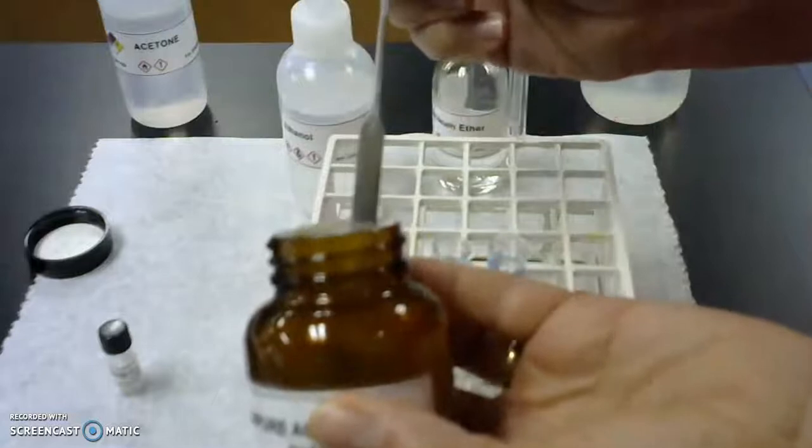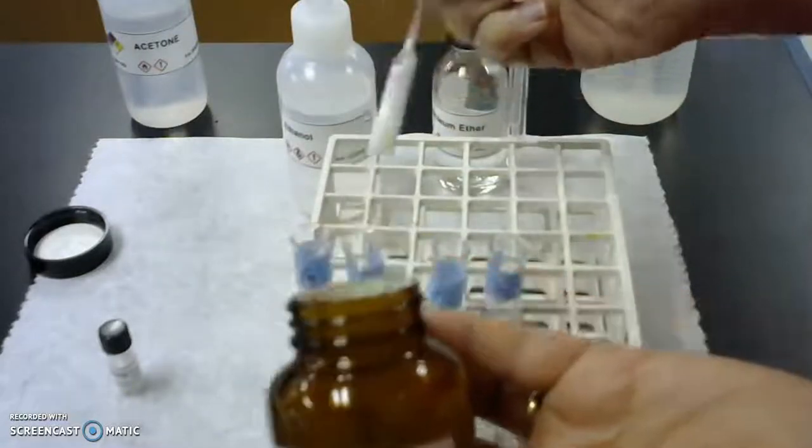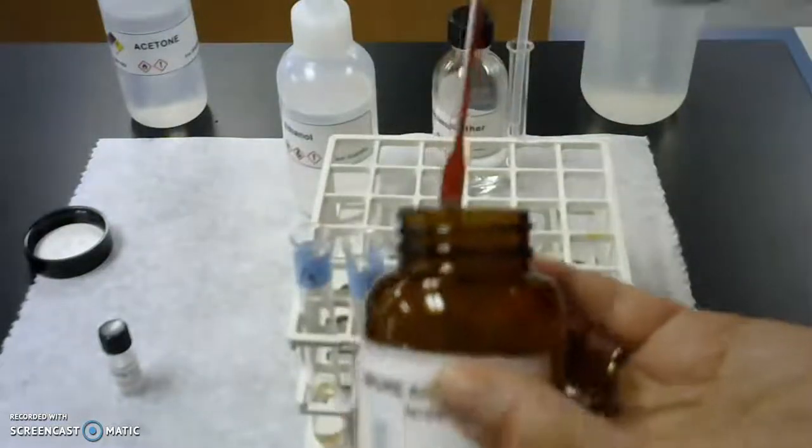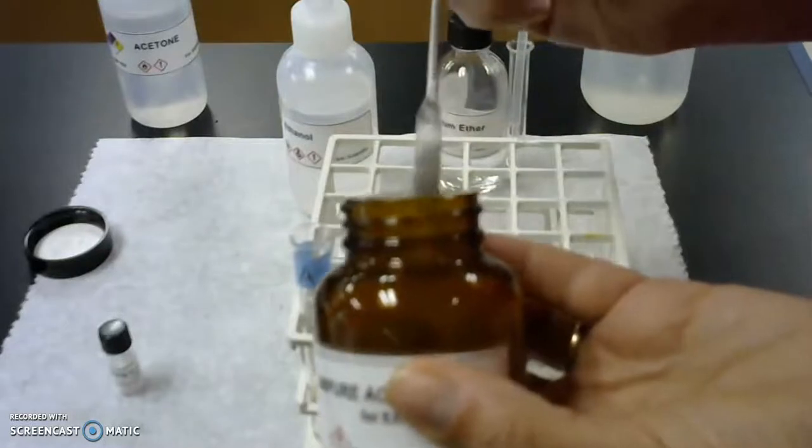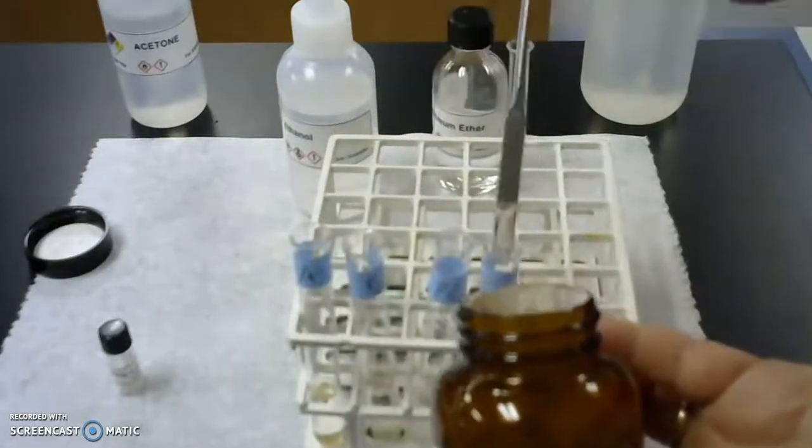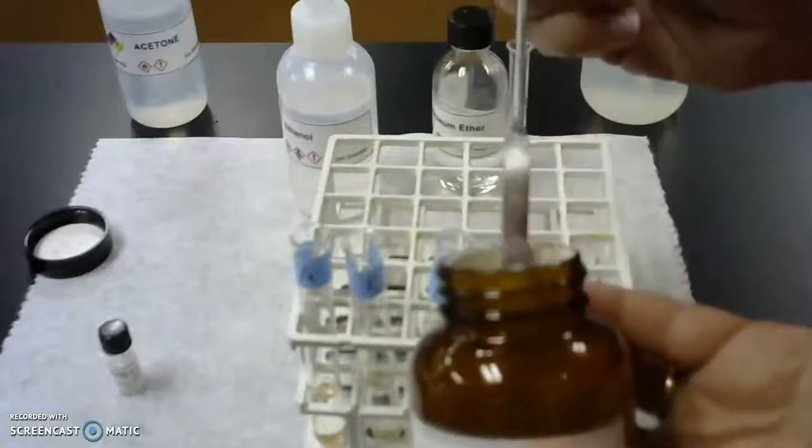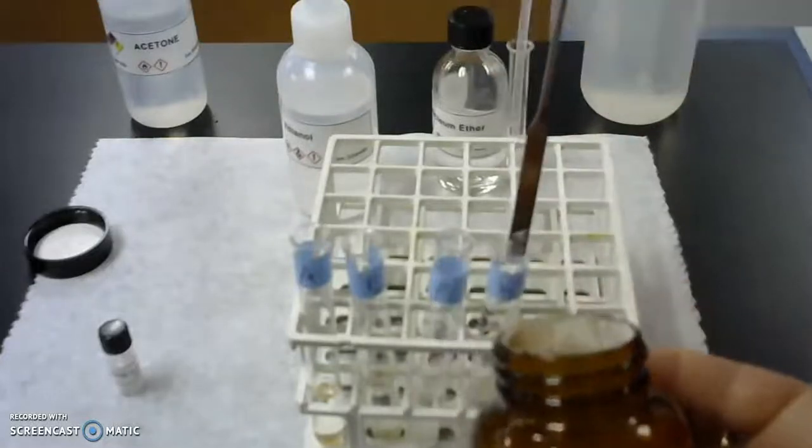That's the ethanol, now the petroleum ether, and finally the water. And just a little bit more on that one.